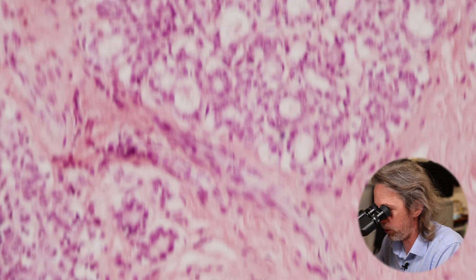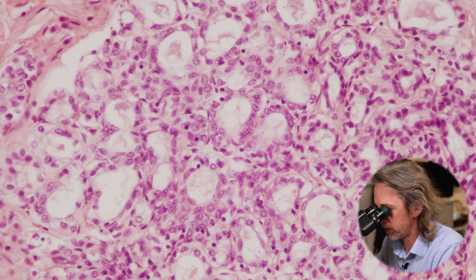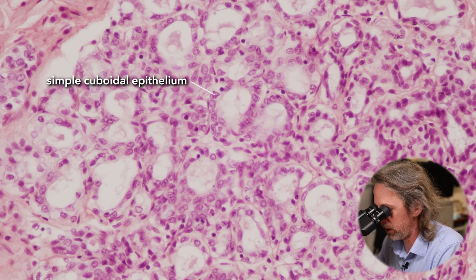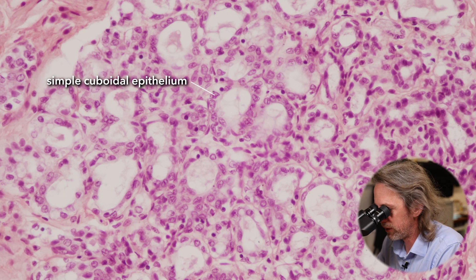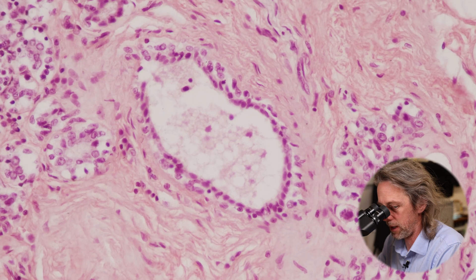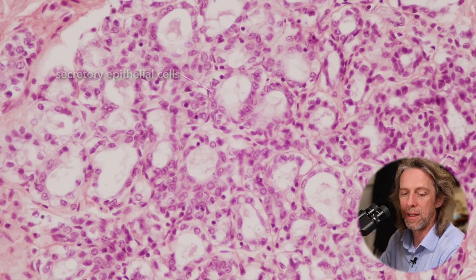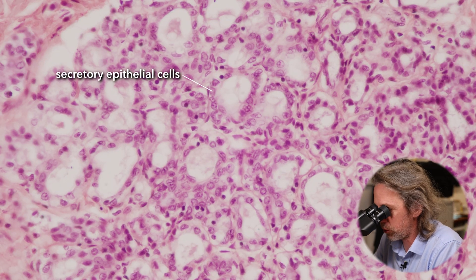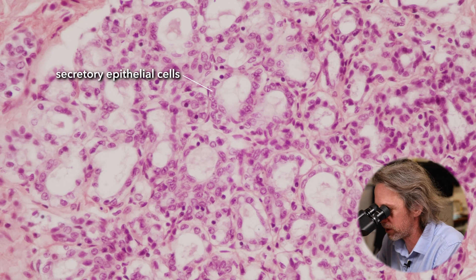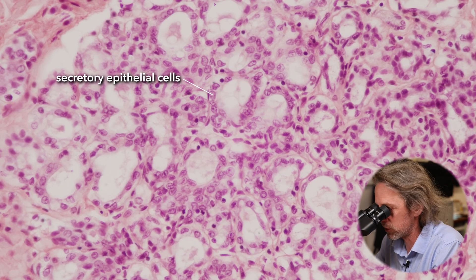If I slide upward to this area, this would be a secretory unit. Can you see how these cells look a little bit different? The nuclei look different — these cells are a little bit chunkier. We've still got a cuboidal epithelium there, but these are secretory epithelial cells. It is essentially the same tube, but these cells secrete milk — they make the proteins and such of milk. And that's what you can see in the lumen: their secretory products.